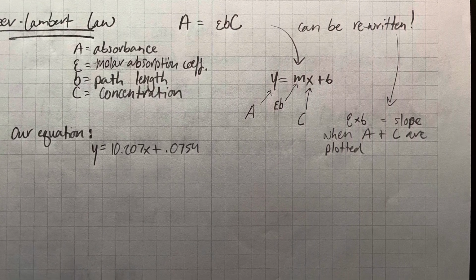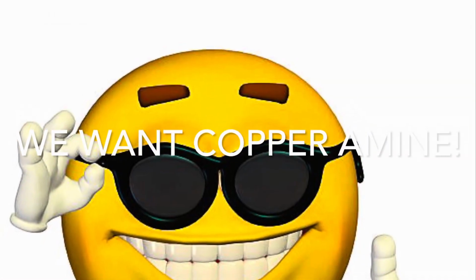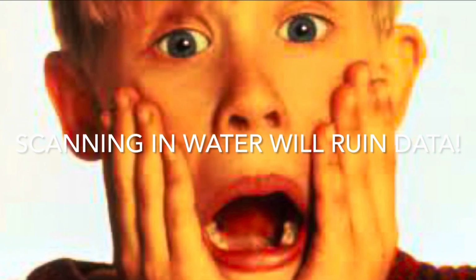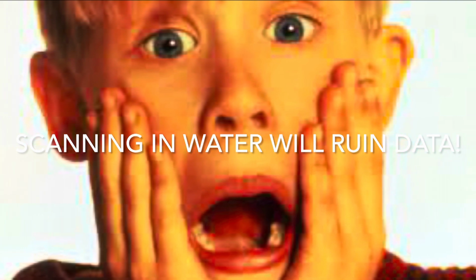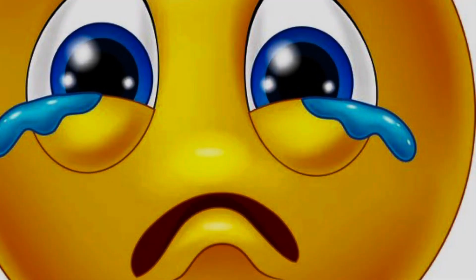This is why zeroing out our scale with a blank is so necessary, because not only will we be measuring what we want to measure, which is the copper amine solution, but we will also be measuring all of the water particles involved in the solution as well, which will in fact skew our data, because we don't care about the water. We care about the copper amine solution that we created. This is also the reason for chem wiping our cuvettes down. The particles will in fact get in the way. This is because the spectrophotometer is super sensitive. Anything that we do not want to look for, we do not want to scan, as it will mess up our final solution.